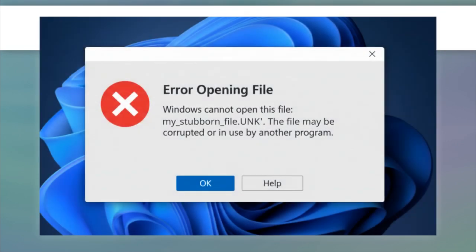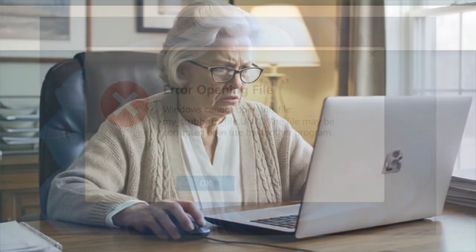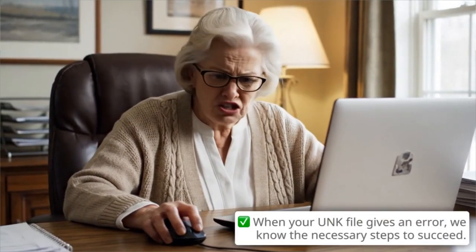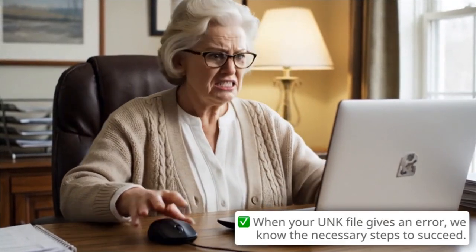If your UNK file will not open, do not worry. This format is tricky. Since the UNK file is so specific, let's confirm your environment. We need to verify these key details before fixing the error.